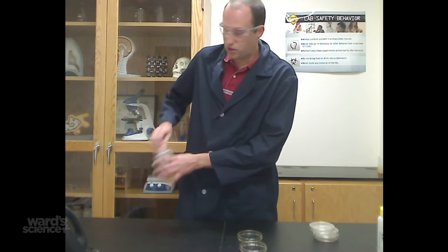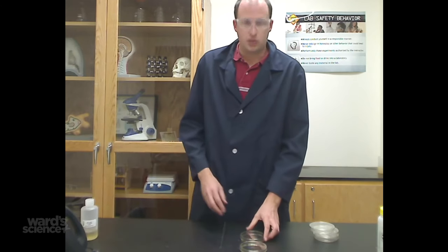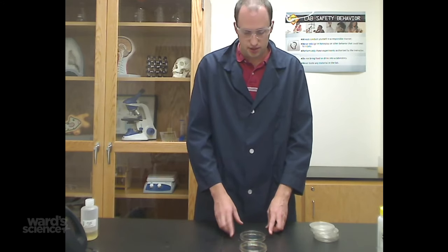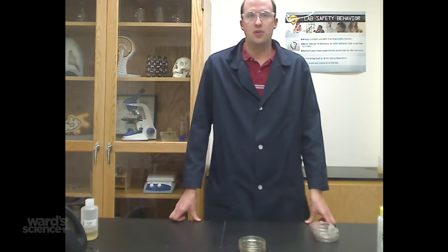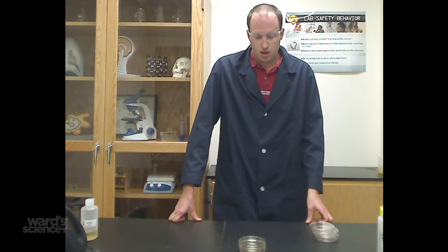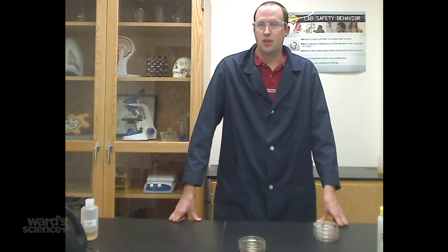Once you have finished pouring your plates, they take about 25 to 35 minutes to dry and to solidify. You can then use those to incubate your bacteria, or you can store them in the refrigerator for up to two weeks before you use them.